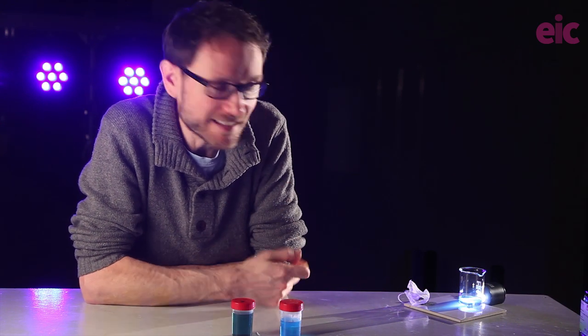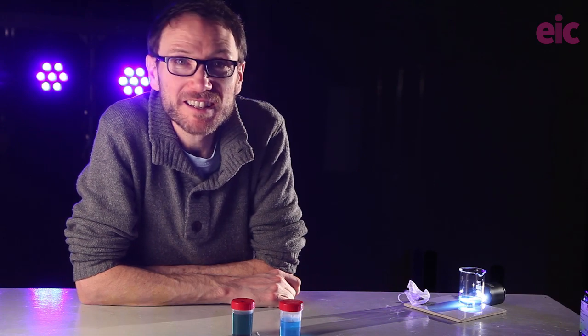After all that, it's still blue. Use my technique.